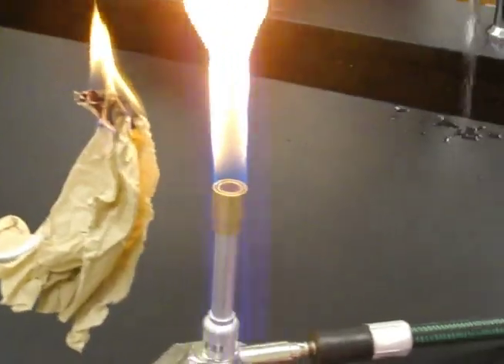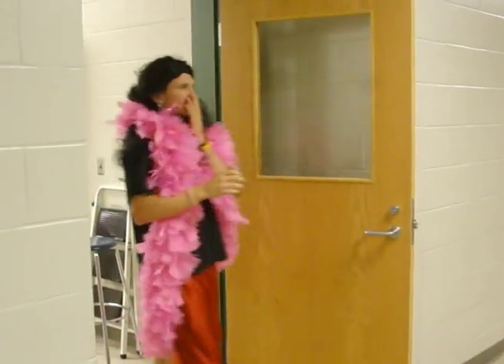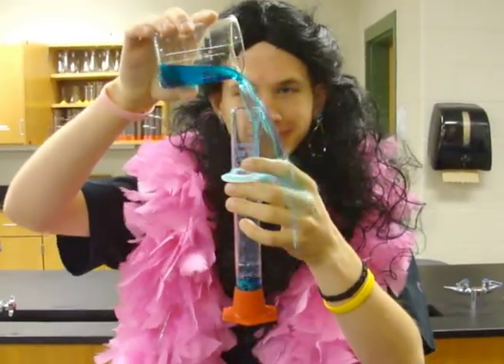If you're working with an open flame, keep combustibles away or you can get maimed. Chemicals make a bad perfume. Waft, don't snort, or you'll have to leave the room. When pouring reagents, keep your distance. Measure from the bottom of the meniscus.